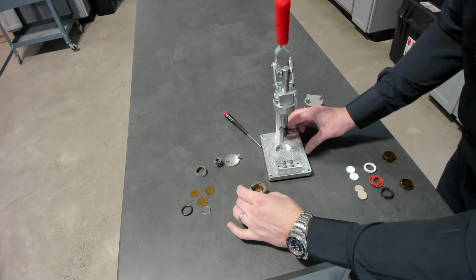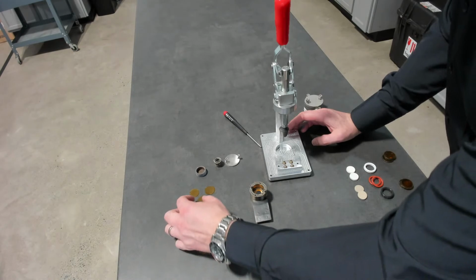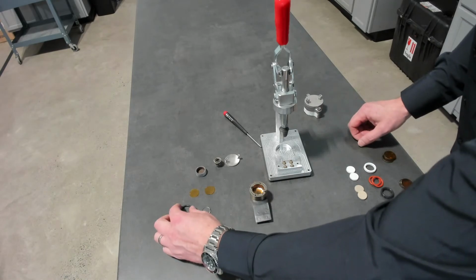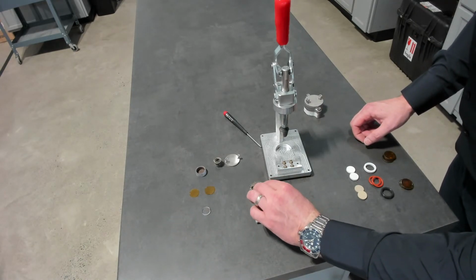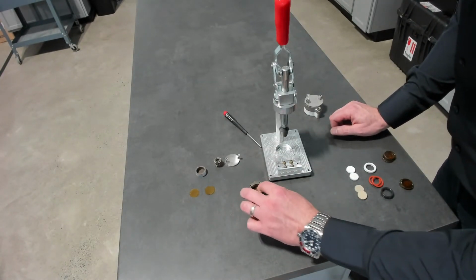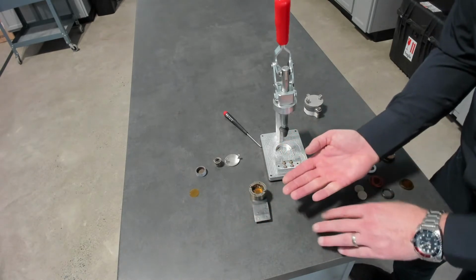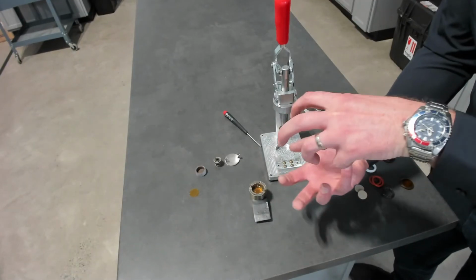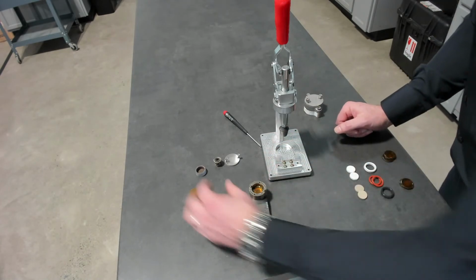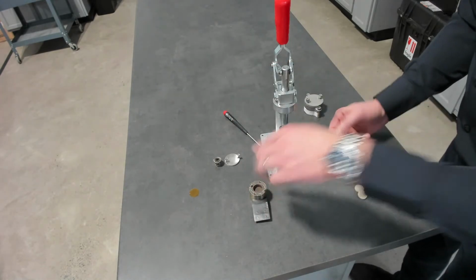And then we're going to use our jig to configure the rest of it. Actually, no, we can put the next steps in. The next step is another layer of Kapton. So we're creating a mirror of what was on the bottom: an O-ring, our sample, and then another layer of Kapton. So that sandwich is 2 contained discs of the sample with 2 layers of Kapton on each side. This is our top portion that will push down and bring it all together.